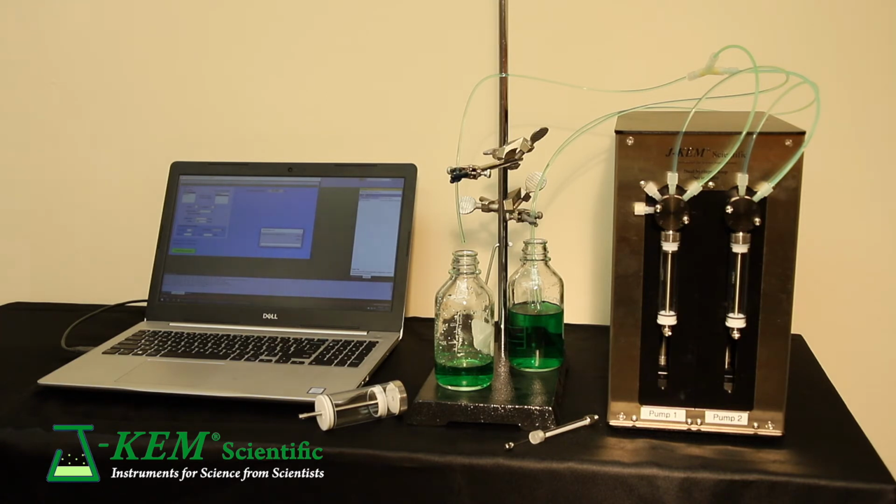So the key points in the equipment side of this is that the pumps are completely inert, nothing but glass and Teflon. They have an incredibly wide flow range, from flow rates from 3 nanoliters a minute up to 750 milliliters a minute. An extraordinarily high precision. That, as I said, that syringe is divided into 3 million steps. So even with a 10 milliliter syringe, you can reproducibly add microliters of solvent.